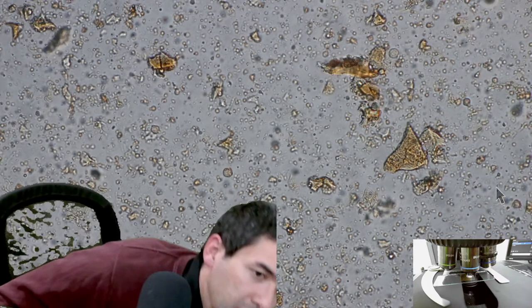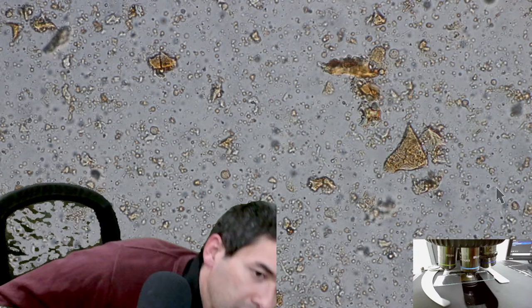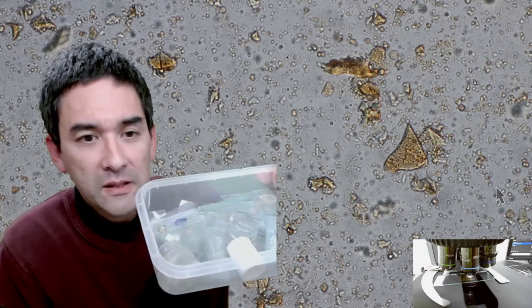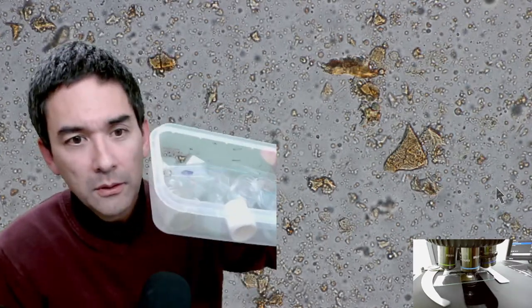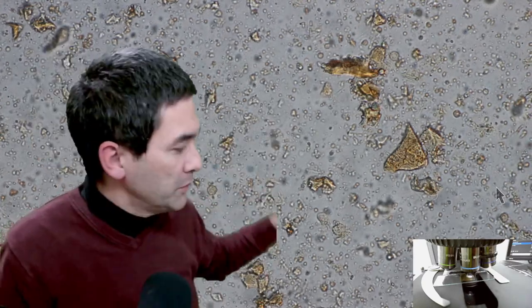Question: could a centrifuge separate fat from oat milk? Fat is less dense than water so it might float to the top. Question: can glass slides be used again? Yes — this is how I collect my old slides and wash them. In many cases it's possible to reuse them. I simply drop all my old slides in water, wash them, and those that can't become clean I throw away.